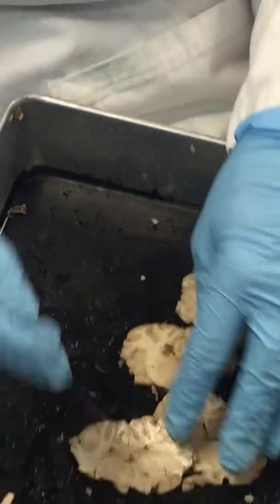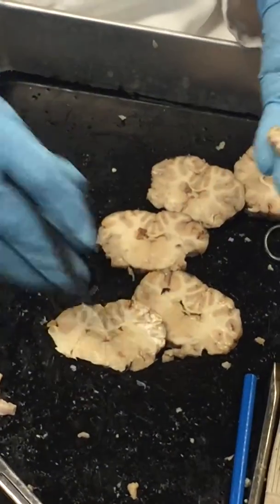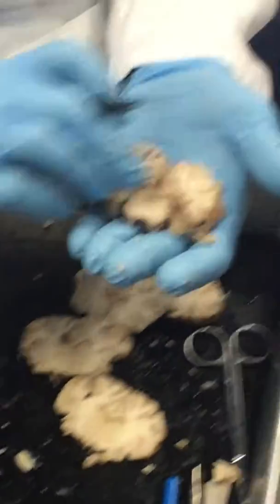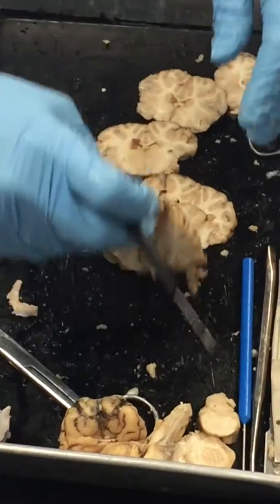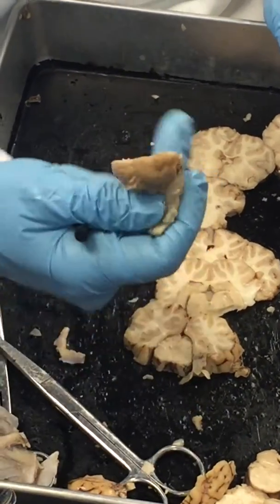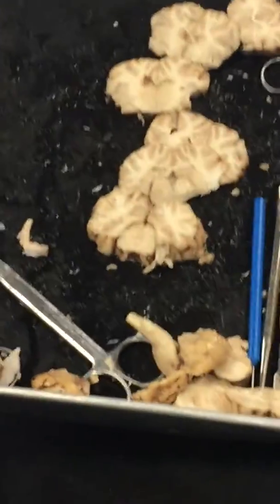And then as we keep moving down, we've got that little pineal gland kind of sitting here at the back end. And you can see a little bit of it starting here, because it goes like this as it's running back, that pineal gland. And then we head into the midbrain, where the superior and inferior colliculi are going to be, somewhere down in here, and then our cerebellum. So that kind of gives you an idea of our cross sections there.